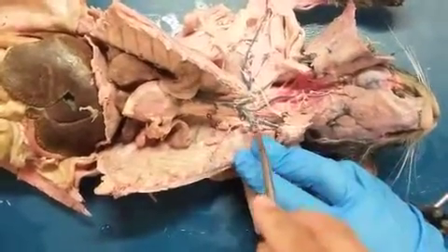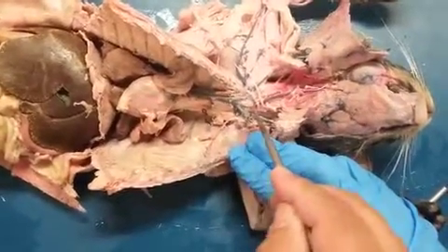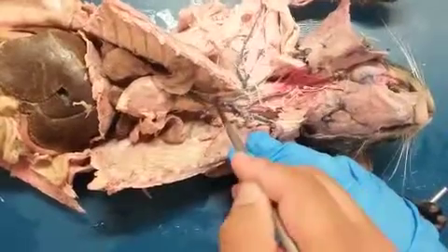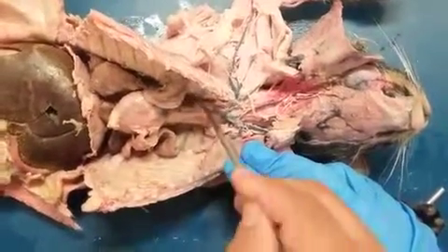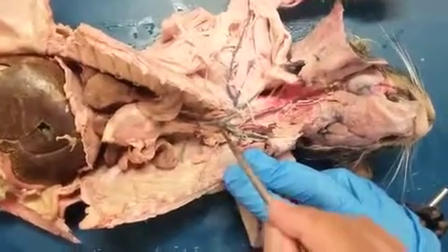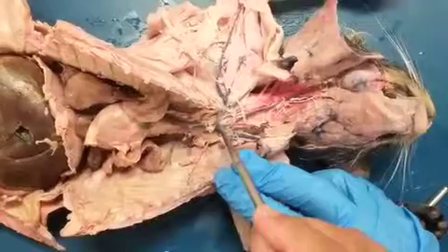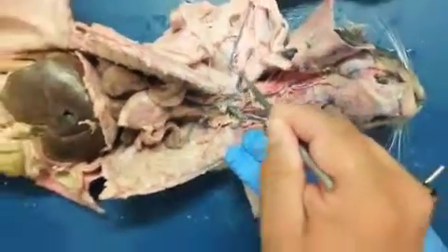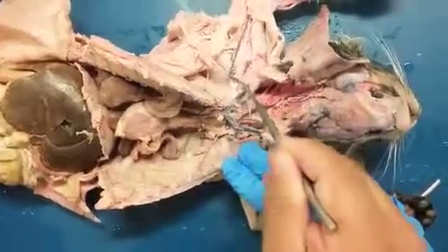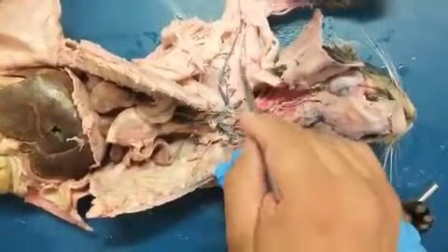So right there, right common carotid, left common carotid, and then the right subclavian is under all of this. But that would be the third one again that branches off of the brachiocephalic trunk. Now you can kind of see it right there, right? Oh, yeah. So there's the right subclavian. As it exits the rib cage, it becomes the right axillary, right? Which is kind of again buried here. Probably need to separate this out a little bit.